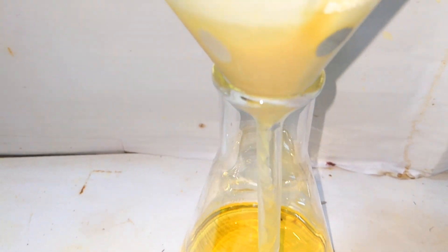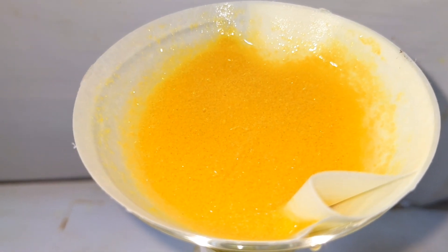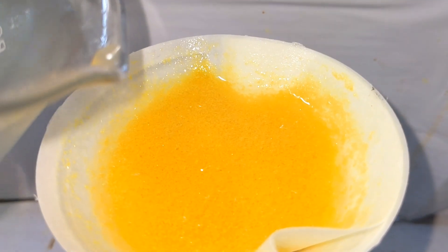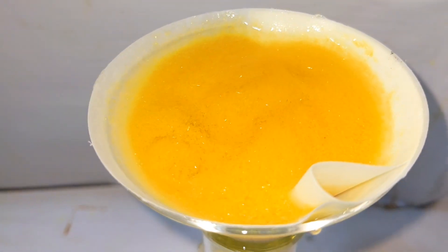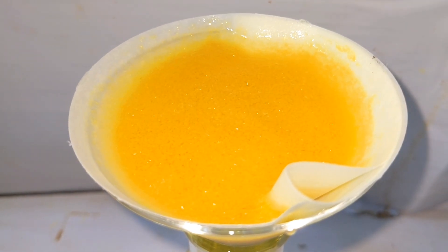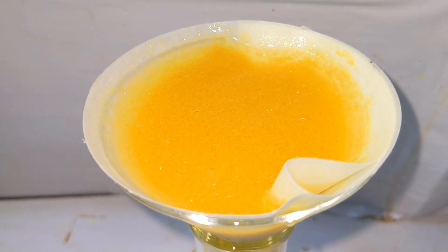While drying, care should be taken that we do not keep the compound under the sun for a longer period of time as that can decompose the product. Also be very careful with this compound as it is very nasty and irritates your eyes.